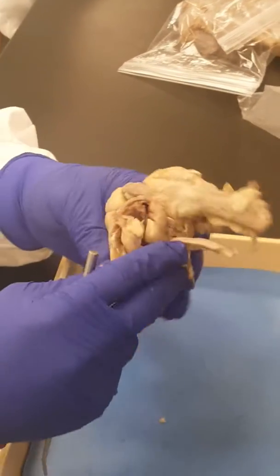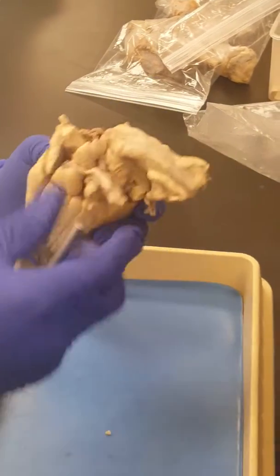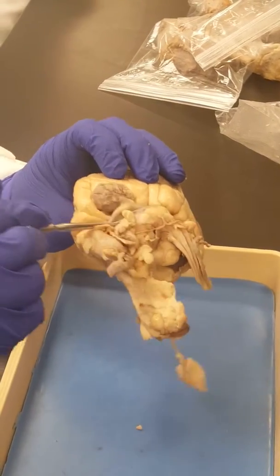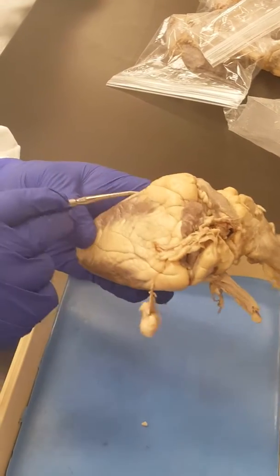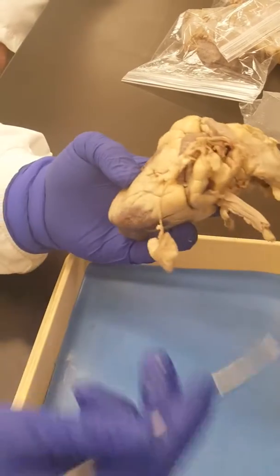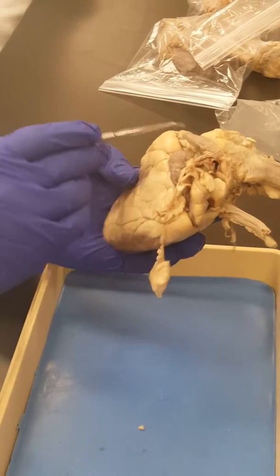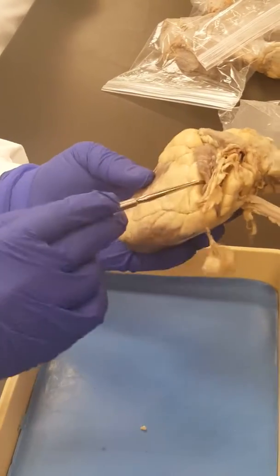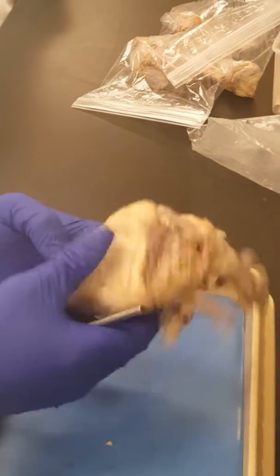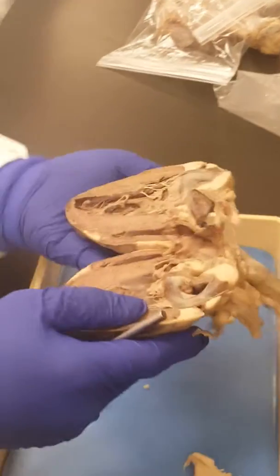So we got all 4 major blood vessels: pulmonary trunk, aorta, pulmonary veins, and vena cava. We've got the interventricular groove, left ventricle, right ventricle, left auricle, right auricle. So we got all the outside parts. And this is what we're calling the base of the heart, even though it's on the top, and this is the apex. Then you cut from the left side going towards the right ventricle, and then you open. Now we got the internal structures.